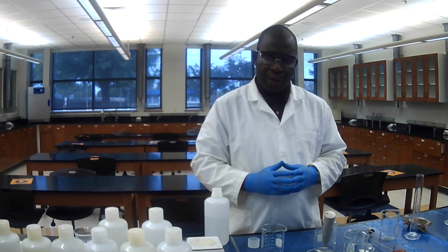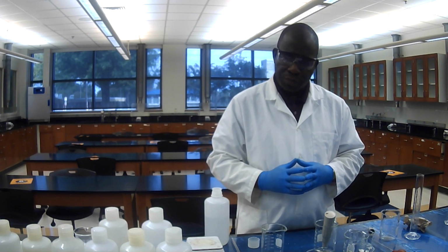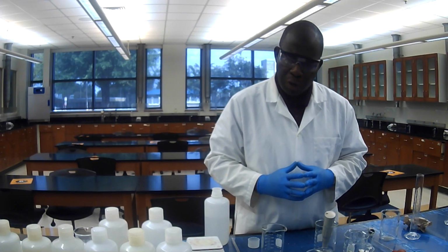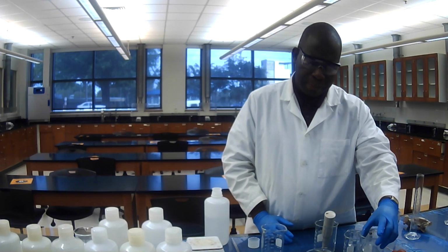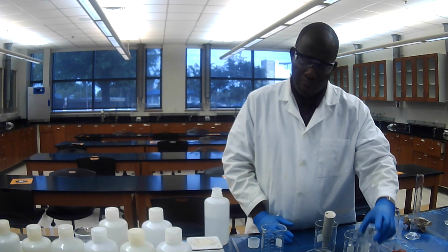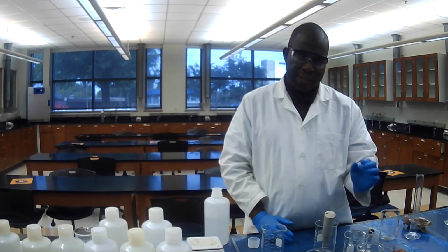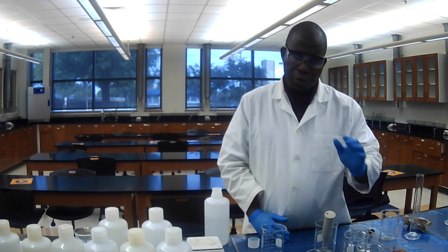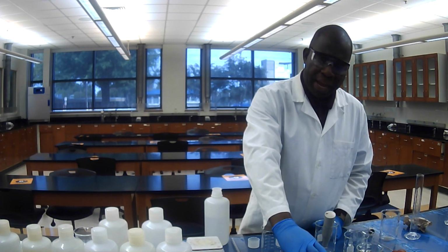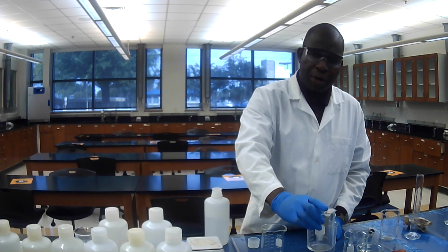After that, you pipette 1 milliliter of 3 molar HCl into one of the beakers containing the dilute buffer, mix. Then measure and record the pH. You do it for beaker number 3. You pipette 1 milliliter of HCl to beaker number 3, and after you have done so, you do the same thing for beaker number 4.